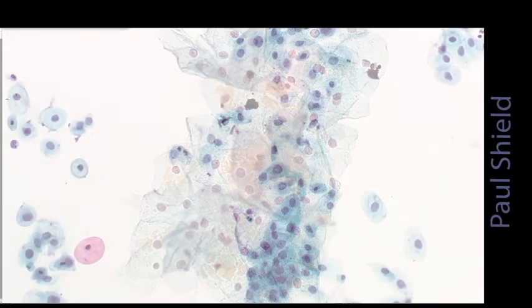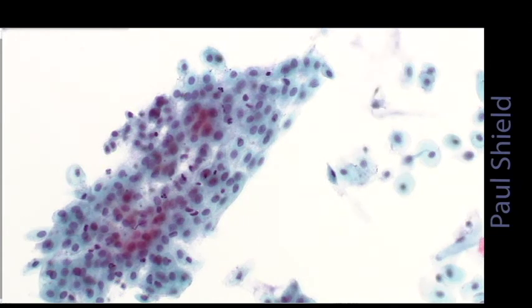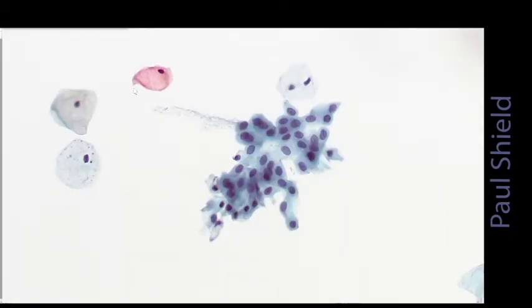So this is a different field. We'll talk about this pattern more in later videos, but you can see it's predominantly immature squamous cells. So these are ones from the lower layers of the epithelium. You can see they're a little more cohesive, so they're forming sheets where the cells are hanging together a bit more than the superficial and intermediate cells that tend to be like this, more isolated or dispersed in arrangement.